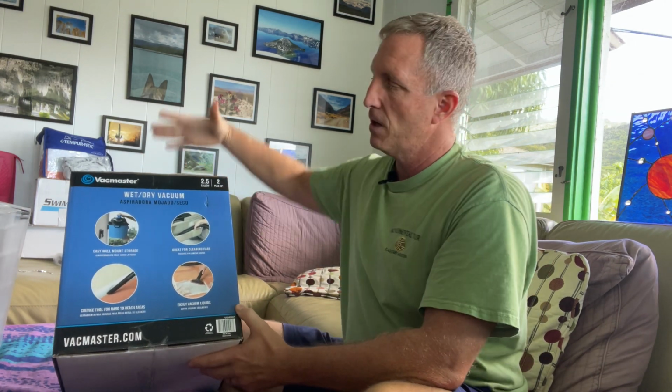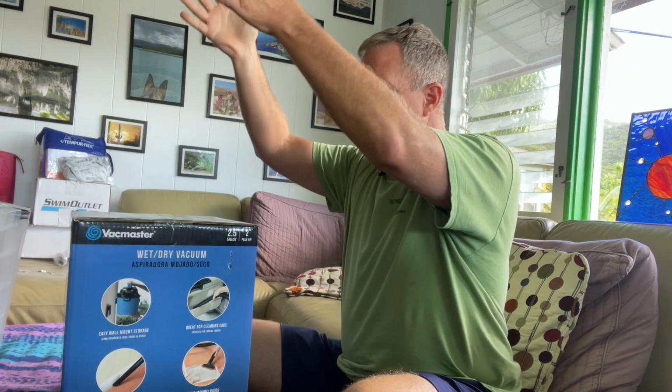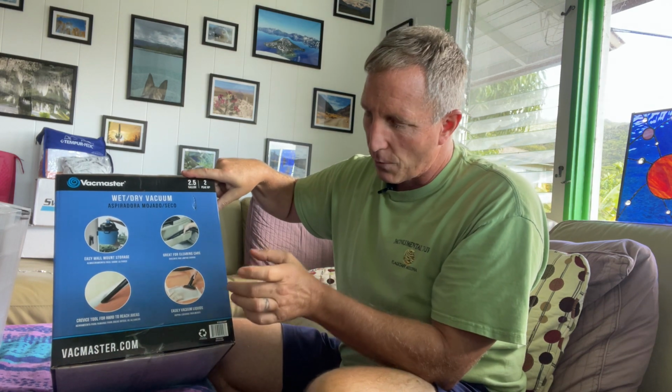We take a box, and imagine this is the filter box, and let's say we purchase 6 HEPA filters of whatever size. Let's just imagine that they're really thick and this would be 6 of them. But now we take the box, put 1 HEPA filter down here, and then take another box that's slightly smaller that will fit inside of this. Put that inside. So now, boom, we mount our fan here. Now we have this area for a plenum area. We have our filter here.